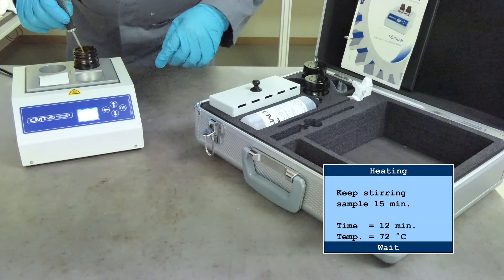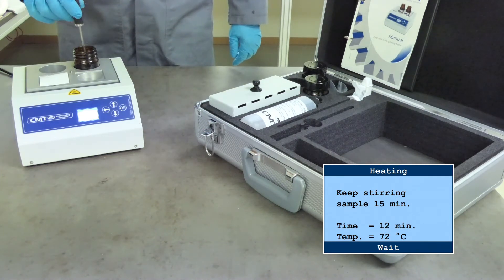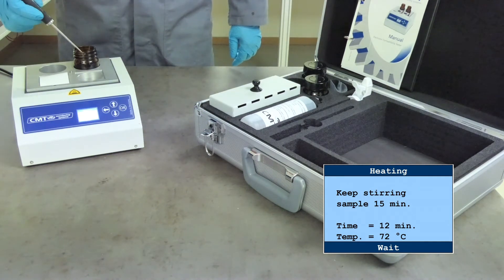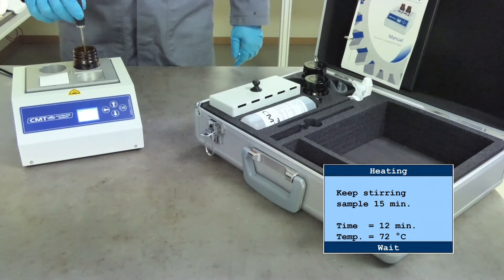Countdown starts at 15 minutes. Keep stirring to maintain temperature of 90 to 95 degrees during the next 15 minutes.